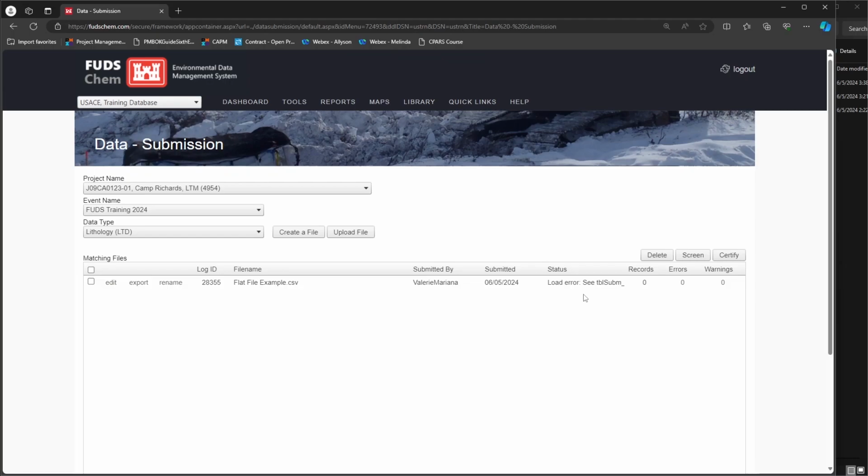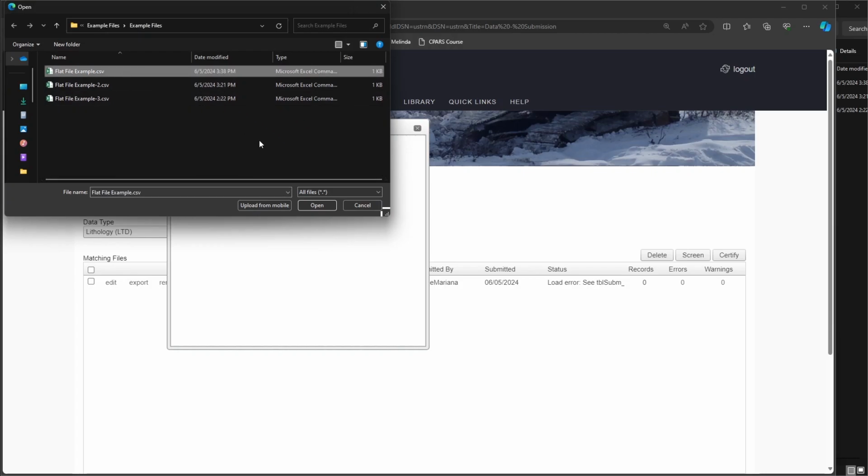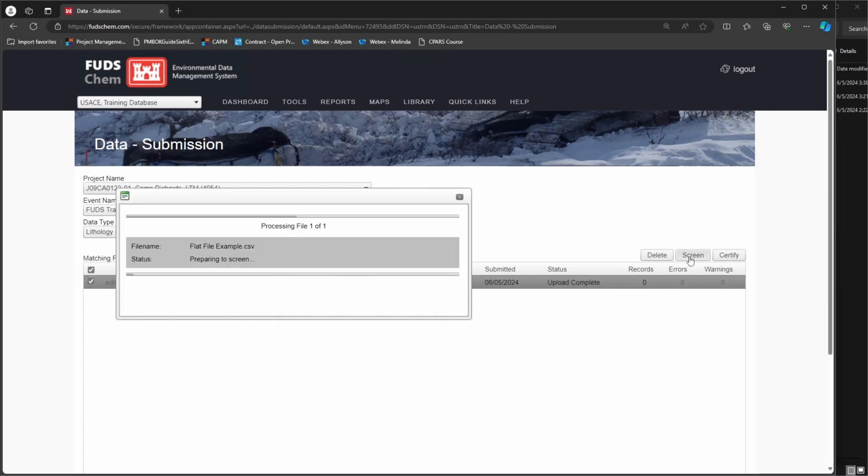We can see that the file was not able to process and has a load error. We can resolve these errors by re-uploading the file with the right file type selected. Whenever you re-upload a file with the same file name as before, you do not need to delete the old one. The system will automatically replace it with the new one. Let's click Upload File. This time, we will select the correct file type of CSV, then click Upload. We can see the file now has a status of Upload Complete, which shows that our fresh copy replaced the old one. When we click Screen, the file is processed successfully, and there are 0 errors.